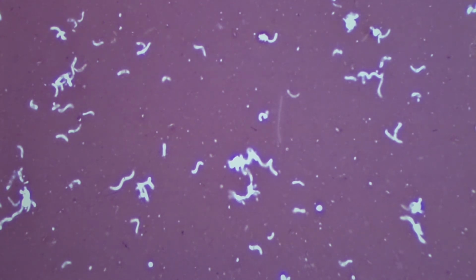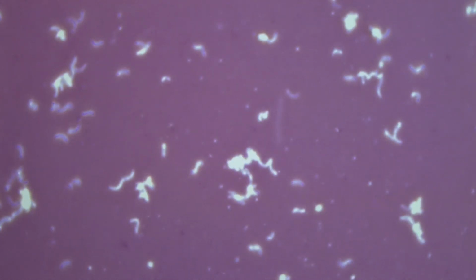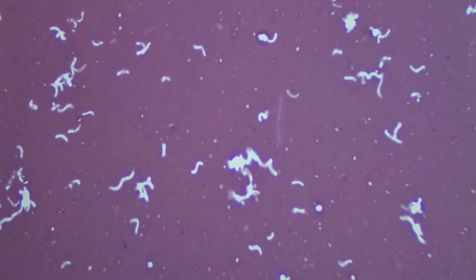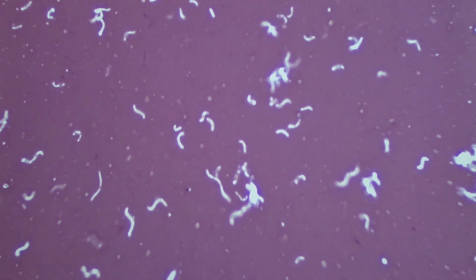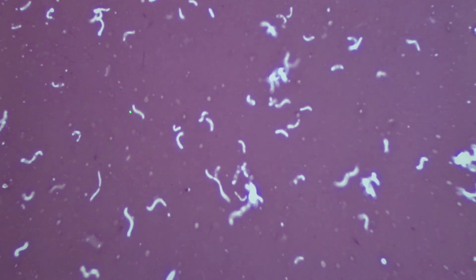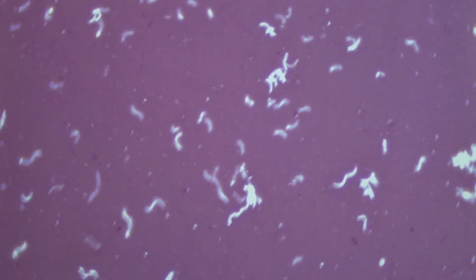And so what you do when you use a simple negative stain is you go to a lavender gray area of the slide, not the real thick nigrosin because you won't be able to get the light of the microscope through it. And here, what it allows us is a view of Rhodospirillum rubrum where we get an idea of the true shape of the cells because the nigrosin is negatively charged and it has repelled rather than stuck to our Rhodospirillum cells. So since they are also negatively charged, the nigrosin stays in the background, occluding the slide. The cells repel the nigrosin and appear white. So look at these beautiful spiral cells.